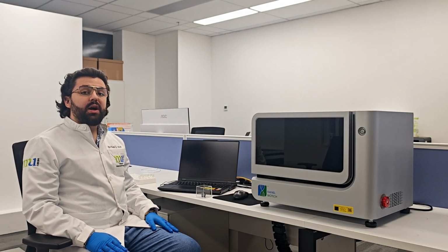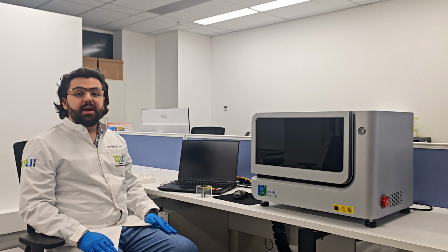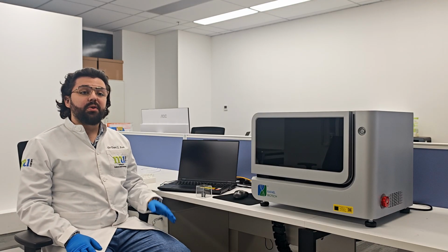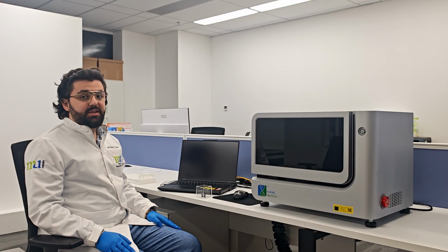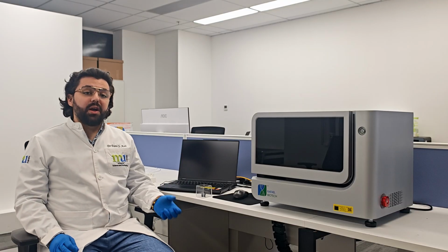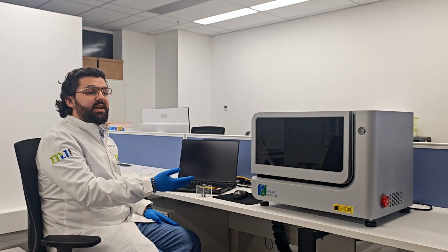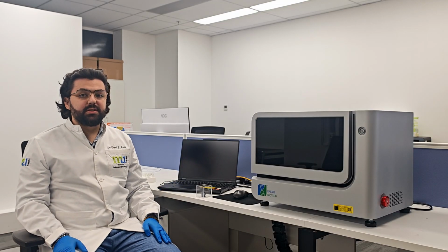Today we would like to show you how to start up the system and prepare it to use. My name is Danny Asi and I'm from Hong Kong Metropolitan University. We are currently actively collaborating with Rafael Biotech Company to use their system in our application.